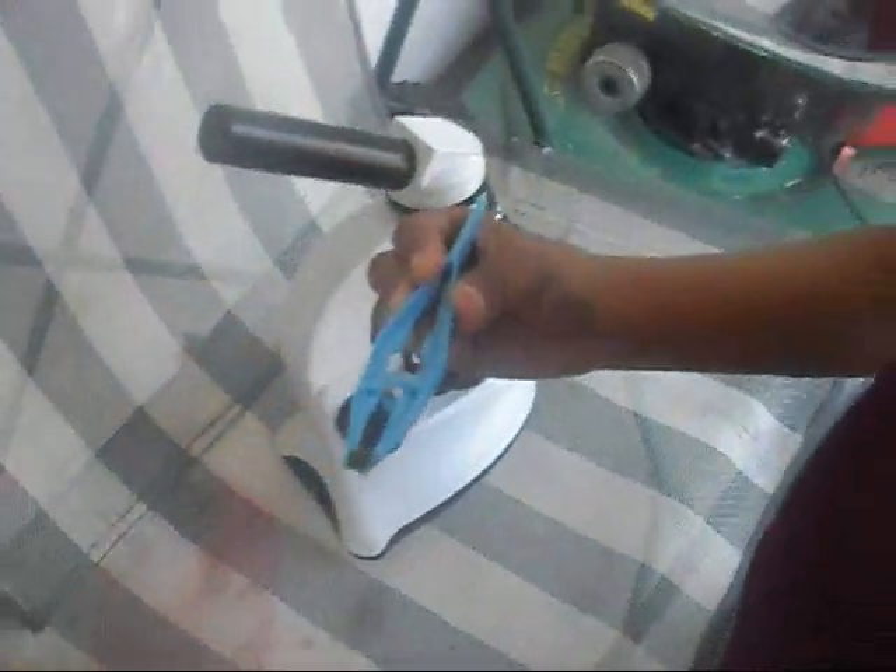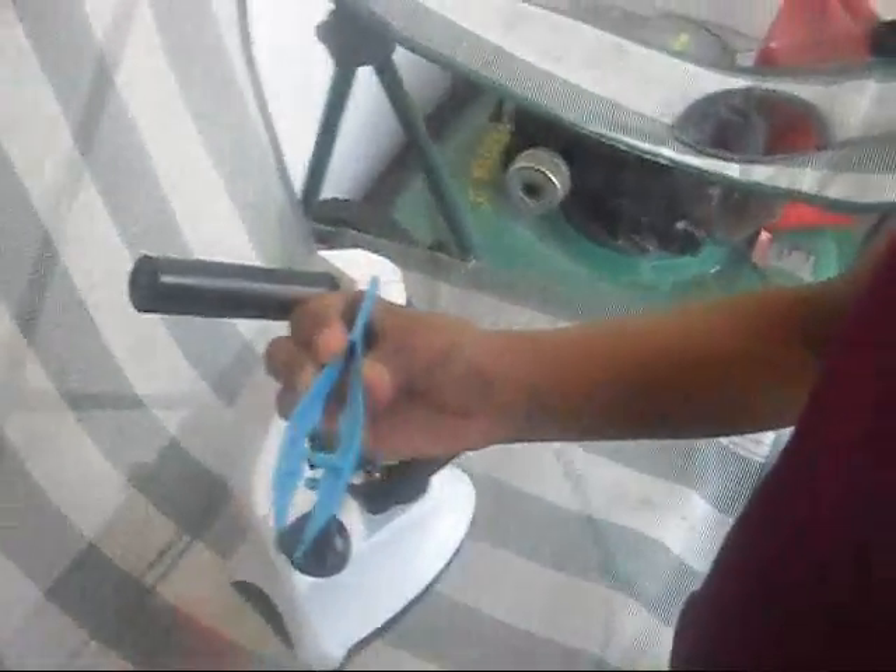We're going to look at it. You dropped it? Let's still pick it up. Please don't drop it. Alright, get the microscope slide. I'm going to get the microscope slide and squish this down.